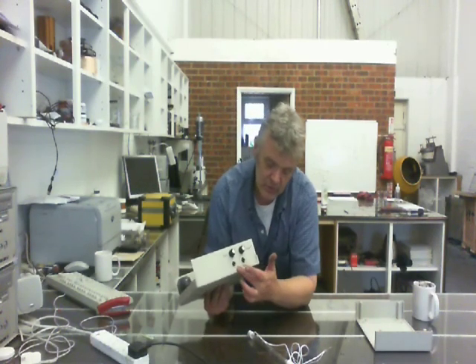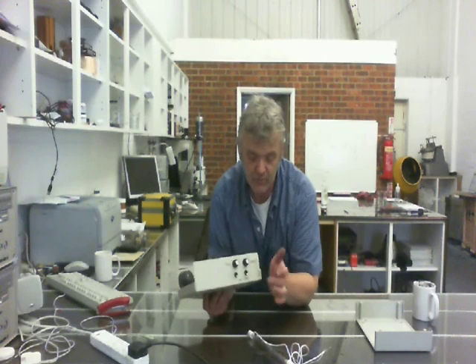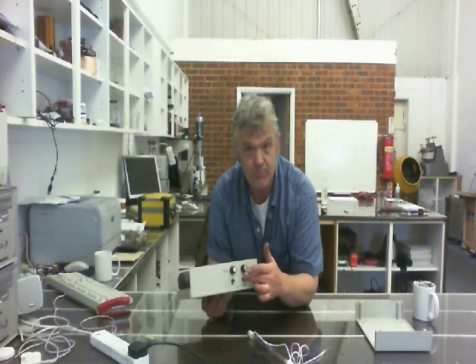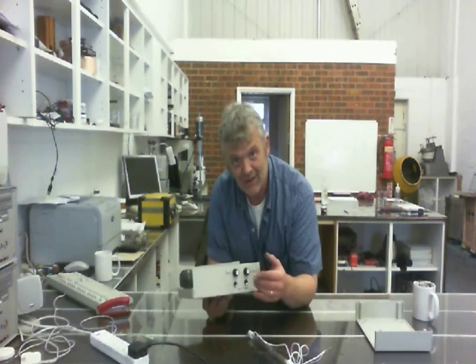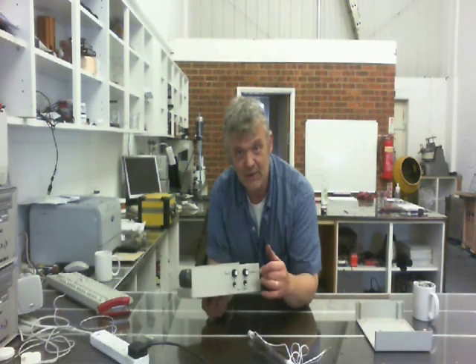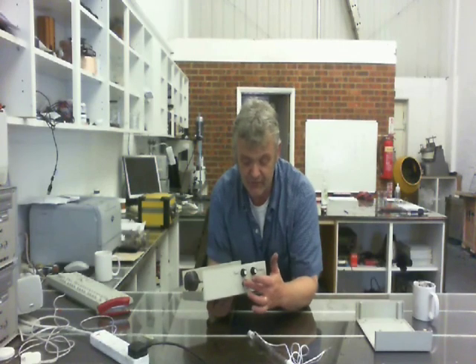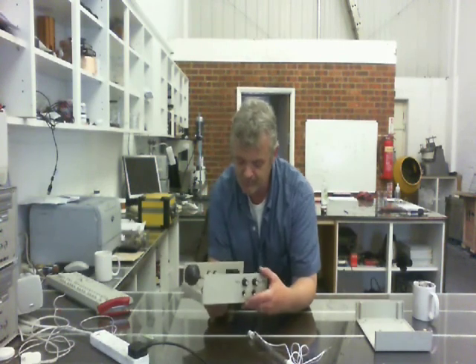So I've labelled this one sync chain, because if I can put an input in here or here, in fact it doesn't matter because they're wired in parallel, but if I put an input in here, then it'll take that input and flash in accordance to the rate of that input apparently. If I have another box that I want to use the same input on, I take from here into the other box and so on.